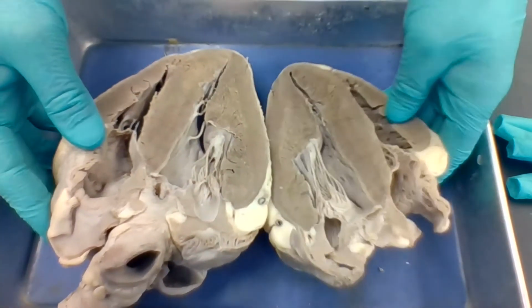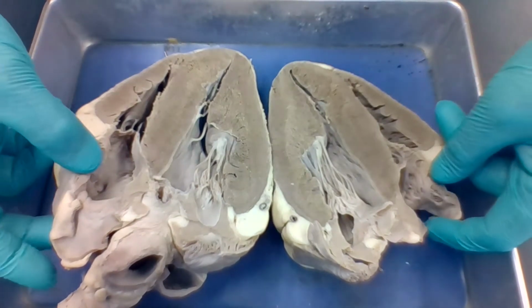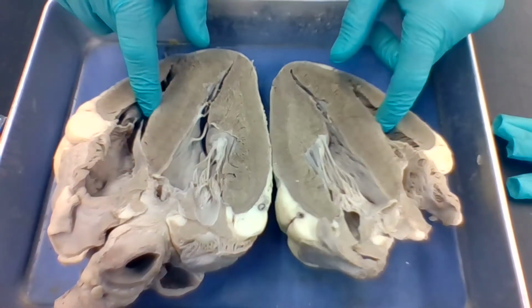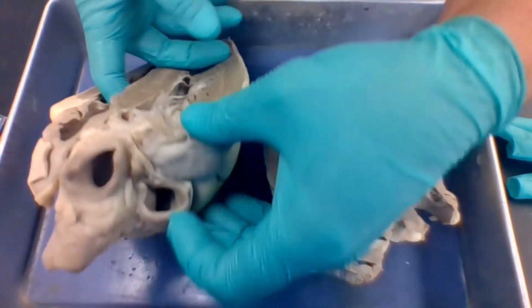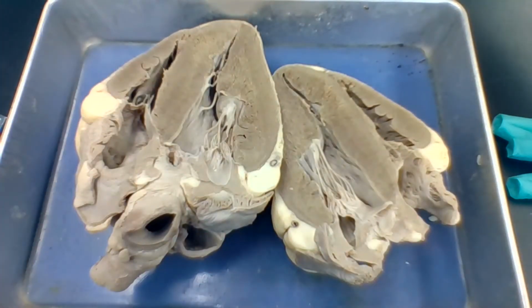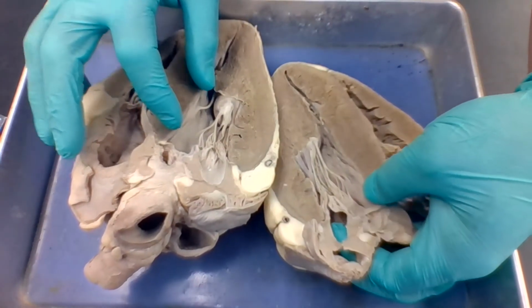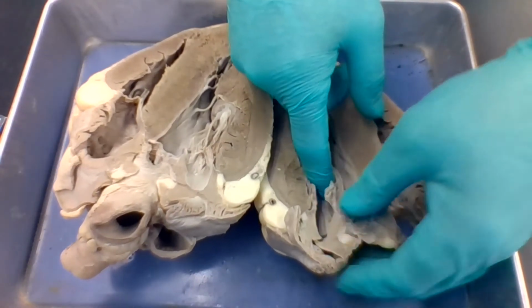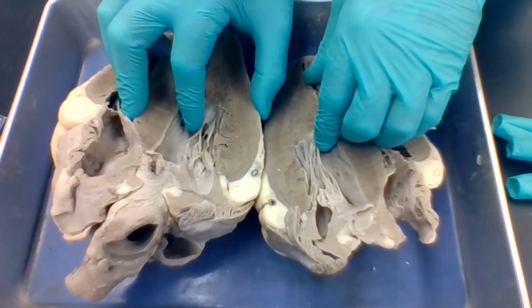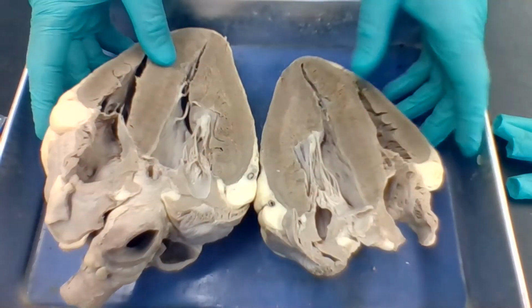of the body. Okay, so a recap real quick. So blood is going to enter through the right atrium, right, superior inferior vena cava, right atrium, through the tricuspid valve into the right ventricle. The right ventricle is going to contract out the pulmonary trunk through the pulmonary semilunar valve to the lungs, and then back the pulmonary veins into the left atrium. The left atrium is going to contract, push open the bicuspid valve or the mitral valve. The left ventricle is going to contract, push open the aortic semilunar valve, out the aorta to the rest of the body.